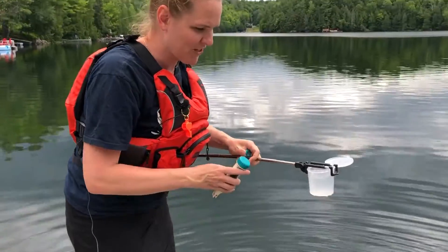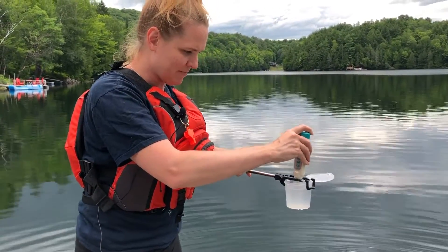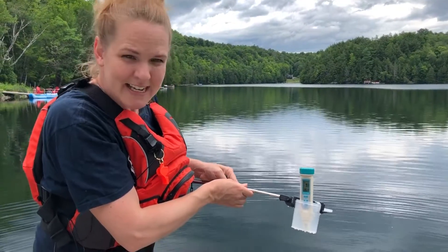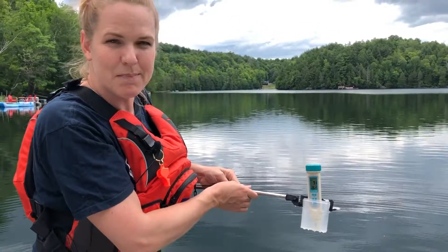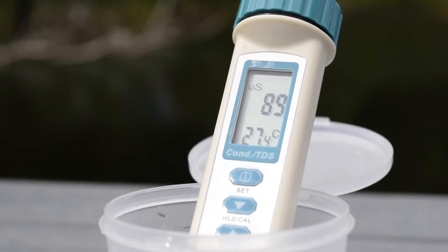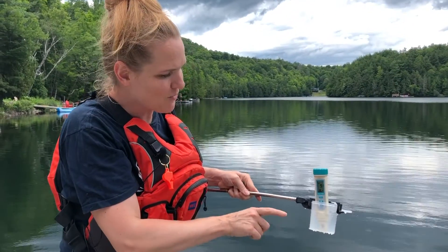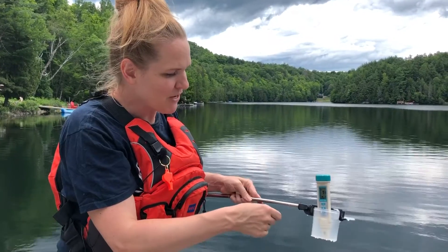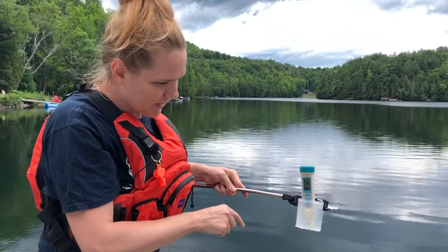You can leave it on your reacher stick or take it off, but you can put it in here. The top number is conductivity in microsiemens per centimeter, and the bottom number is the water temperature. If you're getting a reading below five, it usually means your meter is not in the water properly — it's detecting the air. Make sure you have the cap off and that it's right in the water when you take your measurement.